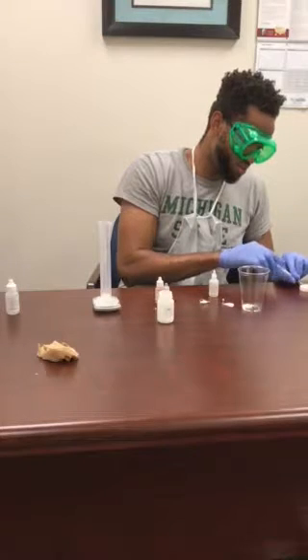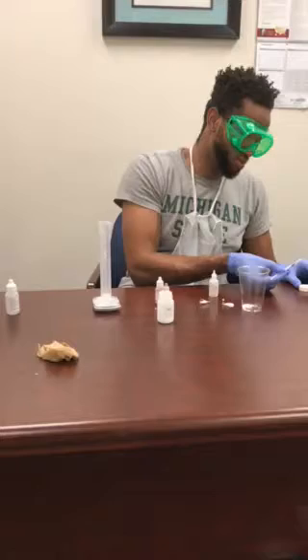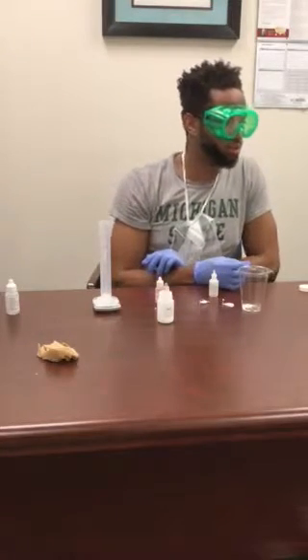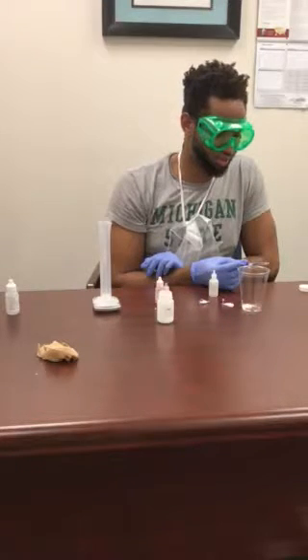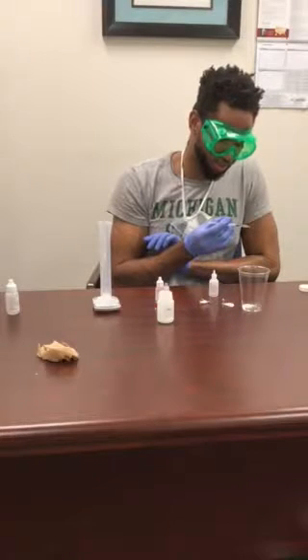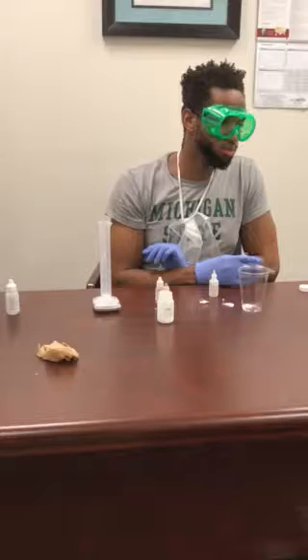Yeah, that'd be good. Nice. Okay, yeah, that'd work. And then record the initial volume of HCl solution in the syringe. Okay, so that should be enough. Maybe we just need drops of it. Hold on.